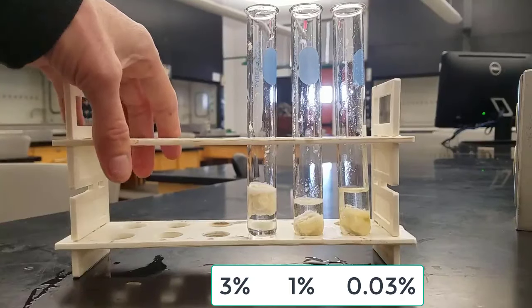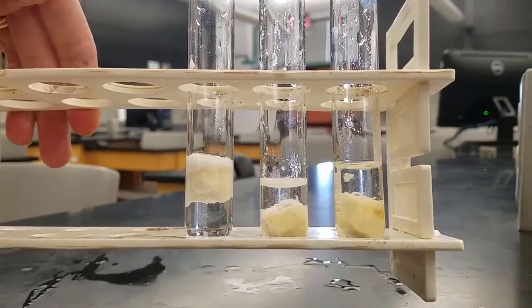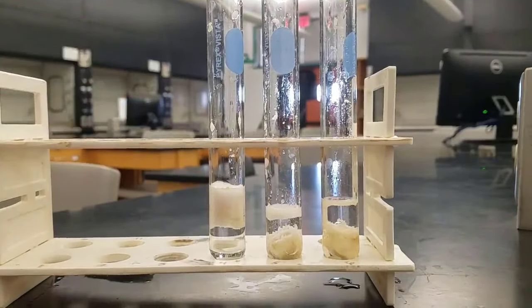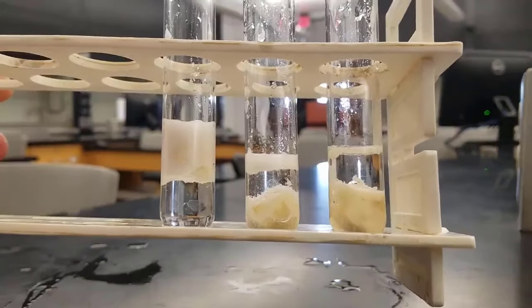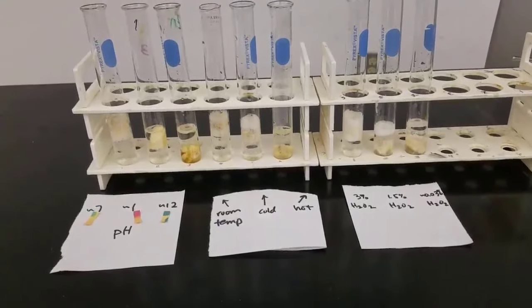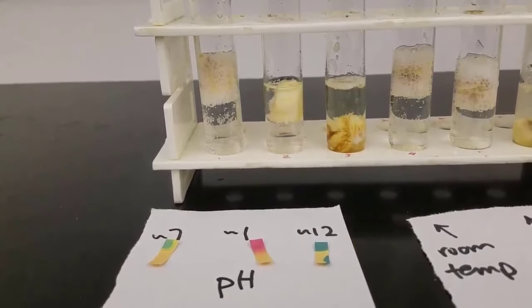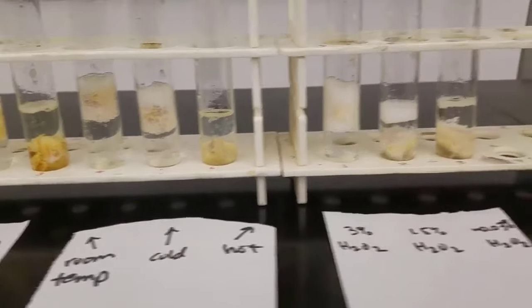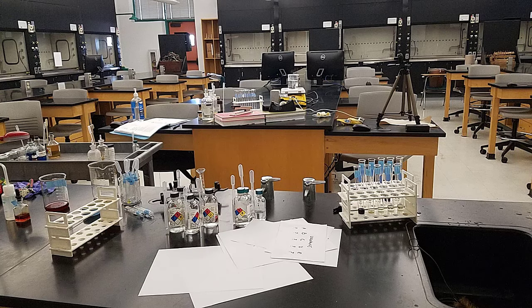You can see some differences in bubbling. In the first test tube we've got thick bubbles forming around that banana. In the second you can see some bubbles coming up. In the third, maybe just one or two bubbles. Over time, there are a lot more bubbles in that first one than in the second, and the third has almost no bubbles at all. Bubbles help us understand if the enzyme is active or not. Revisiting these a few minutes later, here are those bananas at different pHs — you can see some bubbling difference. Here are those bananas from Part B at different temperatures, and here are those bubbles from Part C, and you can see a difference.